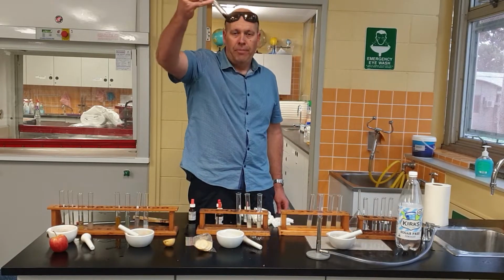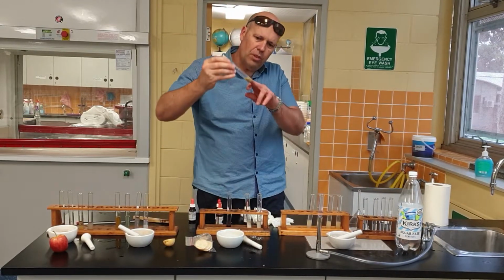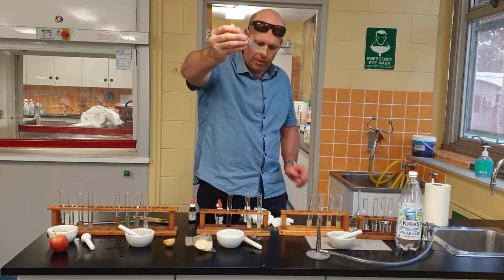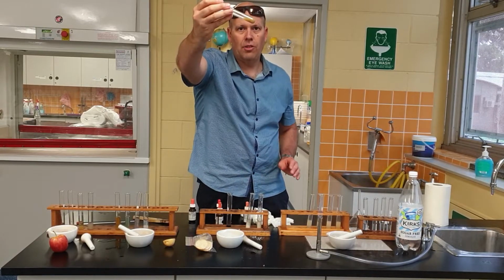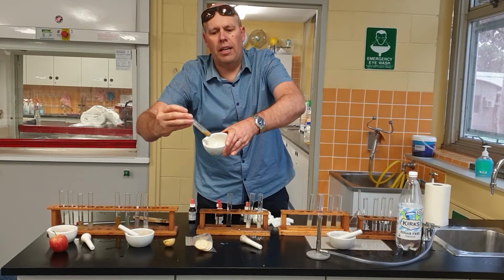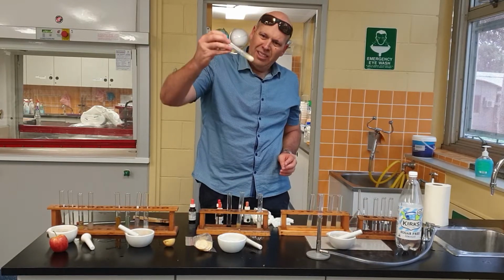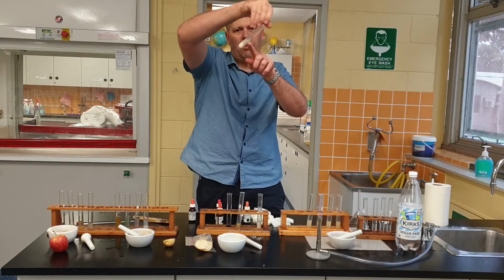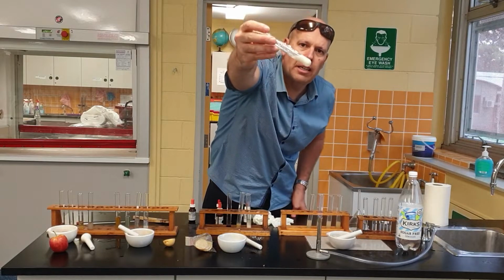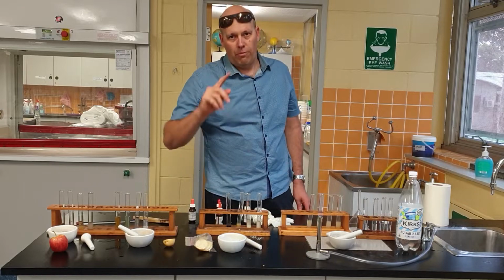So just recapping, rice crackers. We've got starch. Do we have glucose? Well, it looks like we do actually. Yeah, we've got glucose. Absolutely, there's glucose and there's sugars. Look at that compared to what, you probably can't see it, but it's gone that sort of orangey colour. So yes, tick for glucose, tick for starch, protein. I wouldn't even be surprised if it's got a little bit of protein. It's sort of got a little bit purple. And with this one here, we did get a colour change as well. So I reckon tick for all of them. Absolutely. All right, pause the video, write down your results.